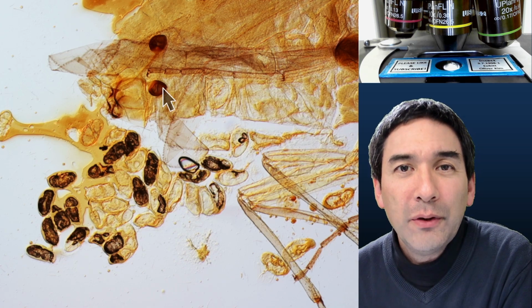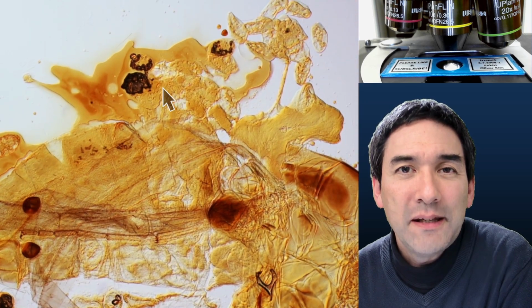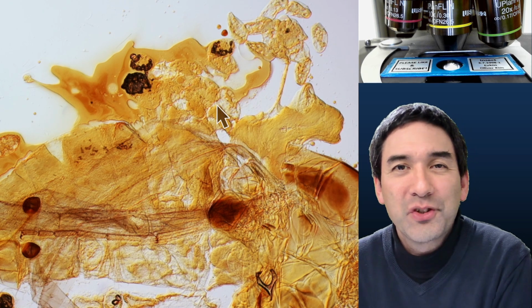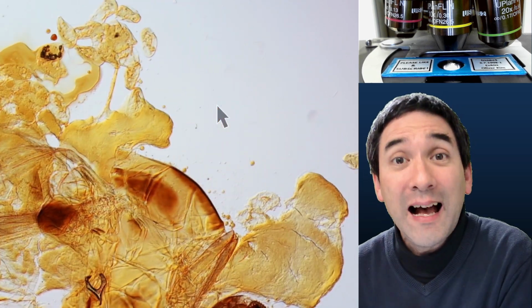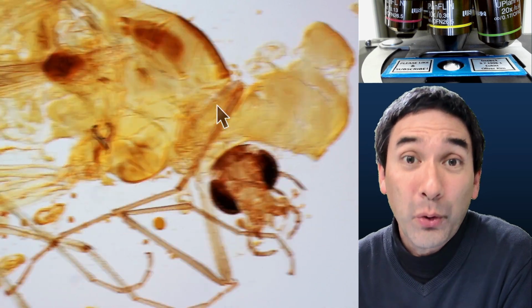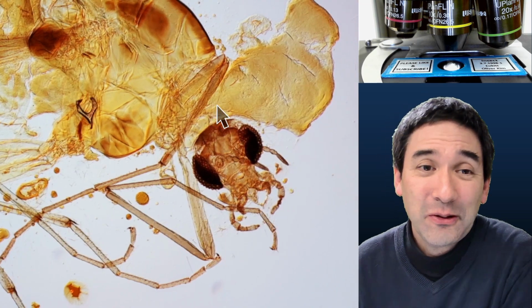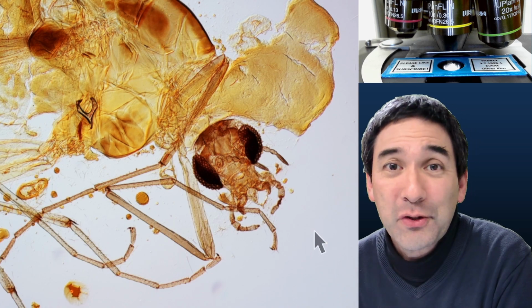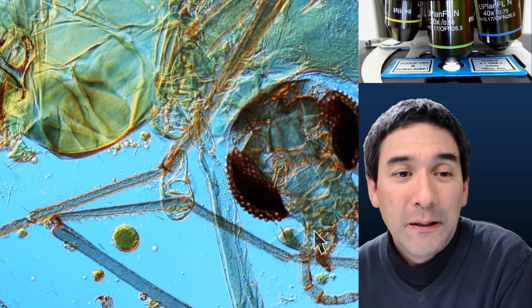And when we look on the back side here, look, all of this stuff here on the back side, that's all basically the insect's contents that have spilled out because everything was crushed. And I'm still happy that the specimen is still as good as it is. It could be worse. At least it's stable, even though it doesn't look very nice. And here, of course, the head of the insect, that is still probably one of the better preserved parts. So actually, I can go up a little bit with the magnification, and then we can have a look at the head a little bit more.